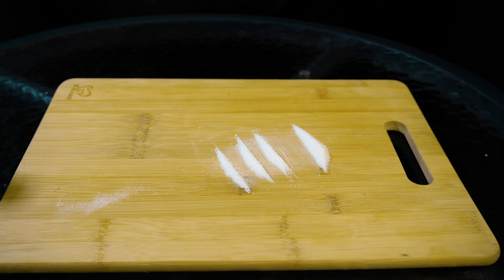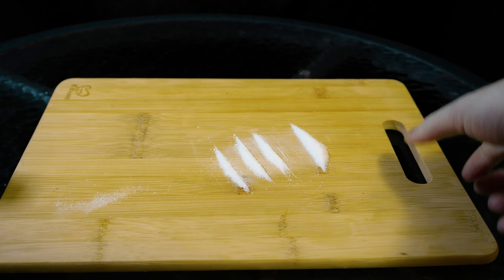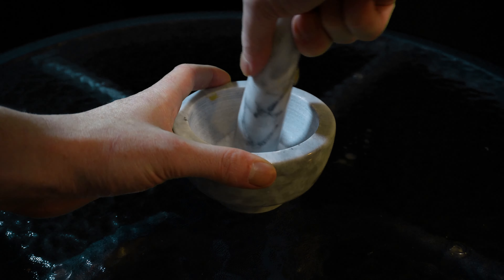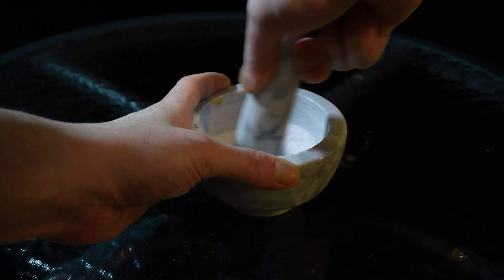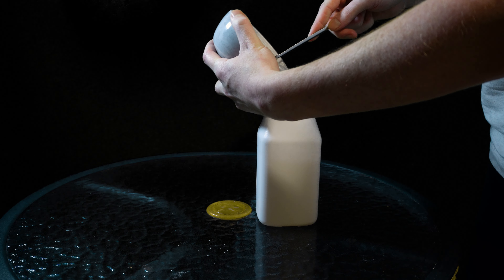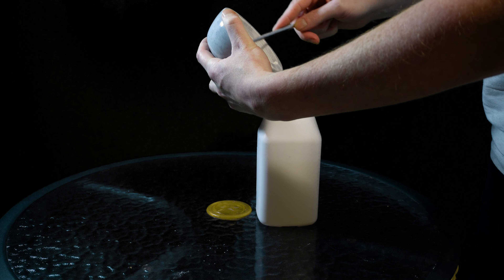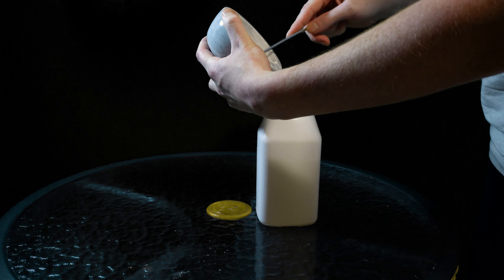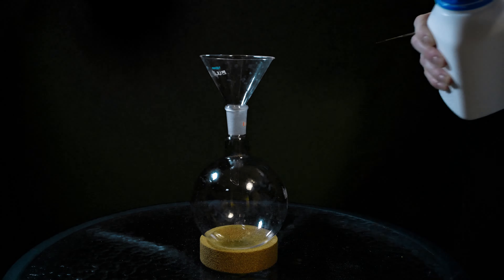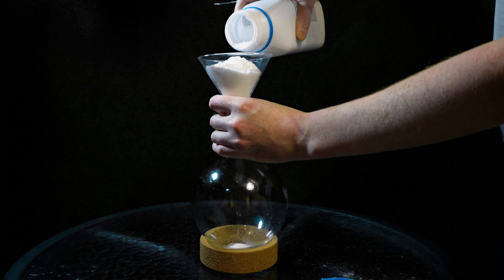I'm going to start by crushing everything up nicely so it can be used. Now the barium hydroxide — about 20 grams. I add the barium hydroxide into my 500-gram adipic acid container and give it a good shake to mix everything. Luckily, the adipic acid comes finely ground already. Next, I add the mix to a 1,000 ml flask, which takes absolutely forever because I don't have a 24/40 funnel.